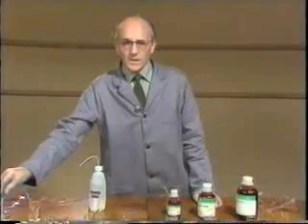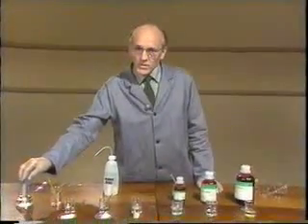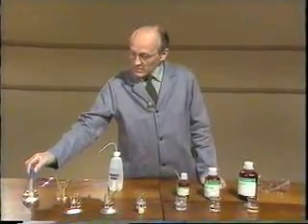We could try measuring the pH of the solution to see if that gives us a clue. A substantial change in pH would confirm that a reaction has occurred. Now, there was very little temperature change for sodium chloride and magnesium chloride, so I will measure the pH of these, and while I'm at it, I'll measure the pH of all of the solutions to see if there's a trend.